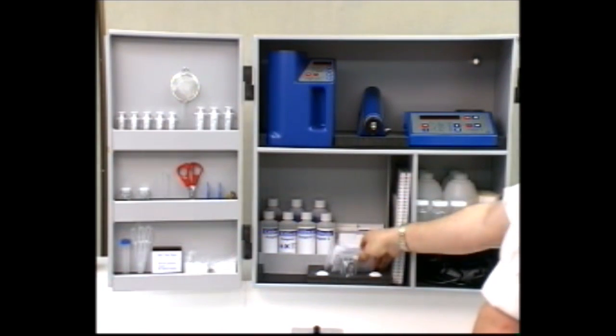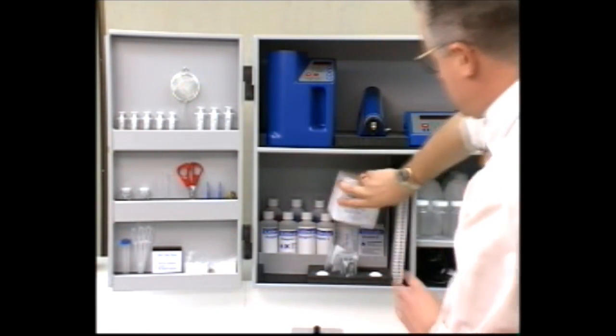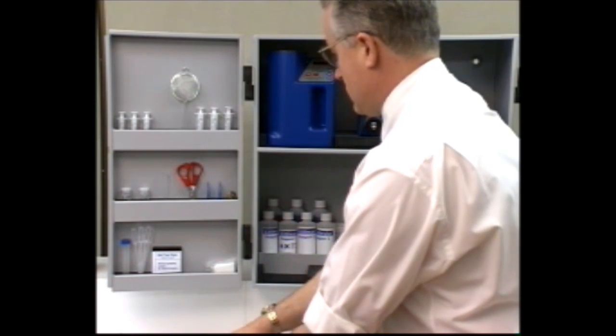This section shows you how to test the stability of a fuel sample and how this can be used to test the compatibility of two fuels.